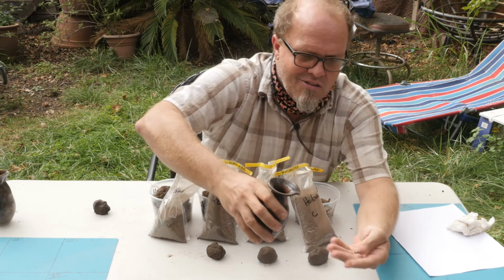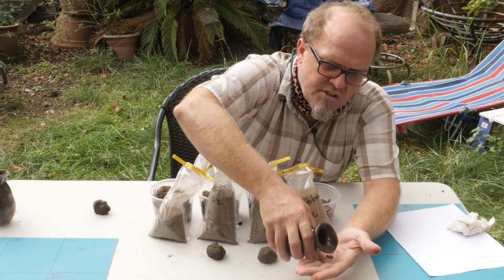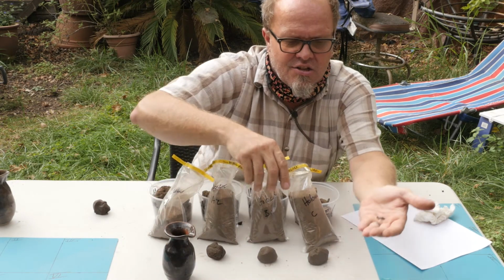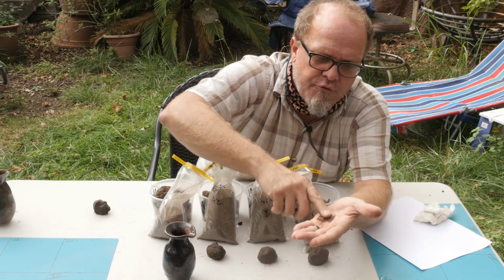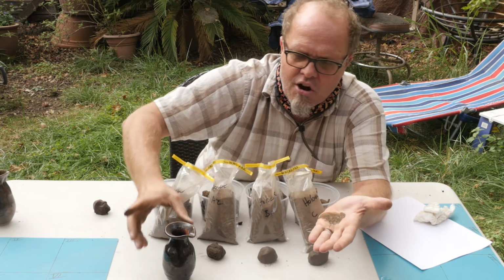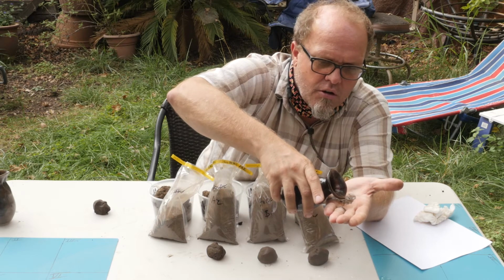Okay. So let's take a little bit of water here and pour it on. This is a great one, no matter what, even if you're not trying to hand texture, to really look for sand and look for sand content. You can rub this thing into a little ball, and you can start to think about, do you see gritty sand particles or not, right?